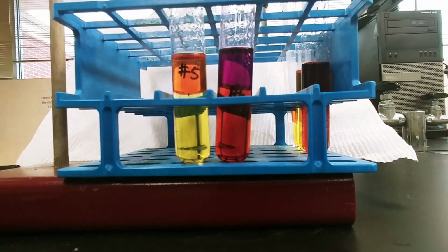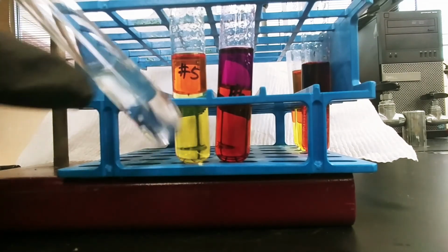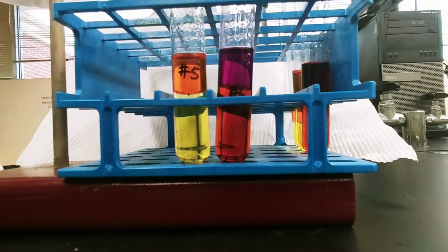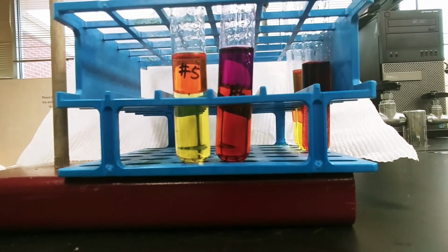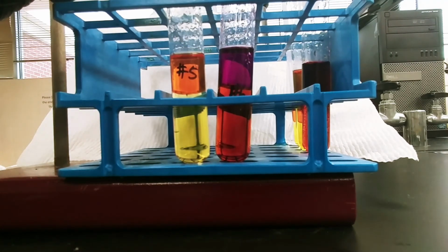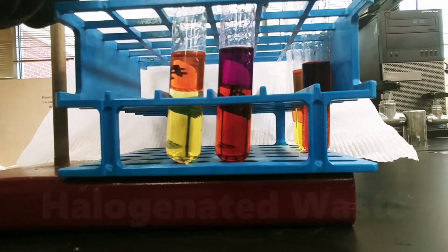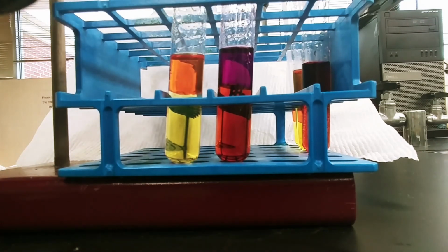And don't forget, guys, when you clean up, anything that has cyclohexane in it needs to go into a separate waste container. Never put cyclohexane into the aqueous waste containers because it'll separate out. We also, because everything has halogens in it, need to put this in yet another specialized waste container, one for halogens specifically. So we have to be very mindful of where we put our waste when we're working with organic solvents and especially when we're working with halides.